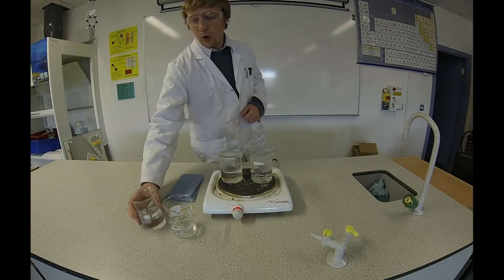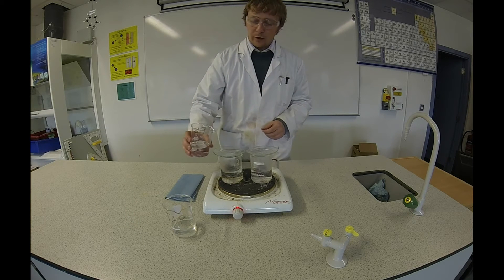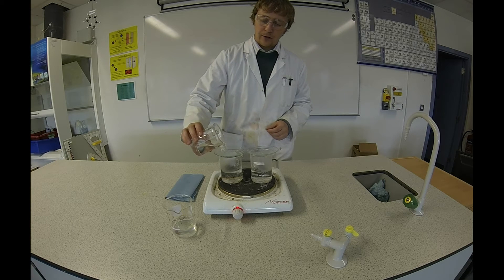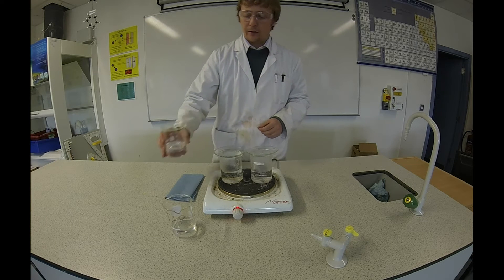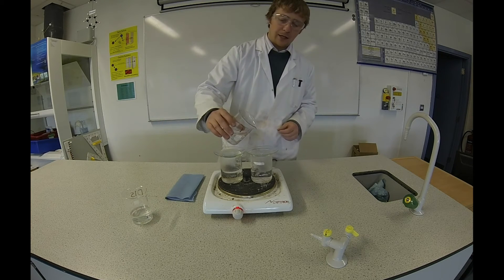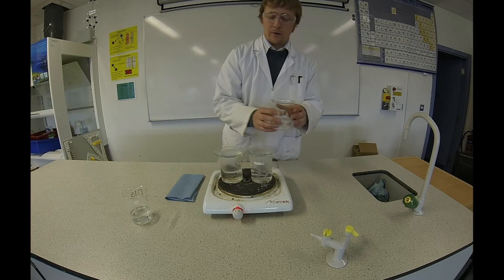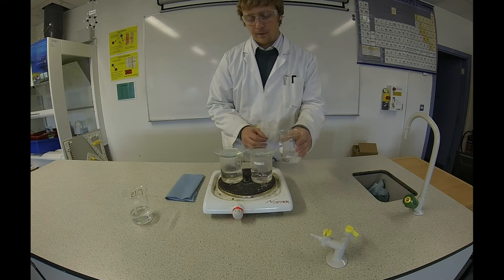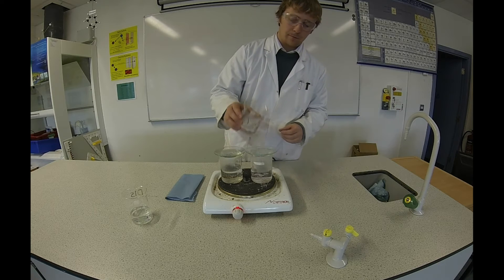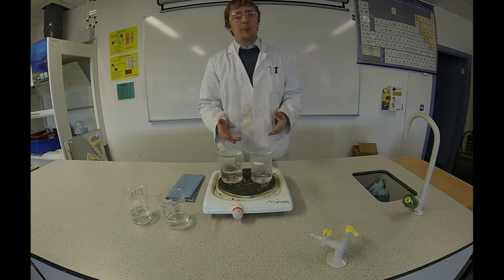Now I'm just going to pour a sample of each water onto each clock glass. So there's my distilled water there and my tap water. Okay, so we'll leave these to boil.